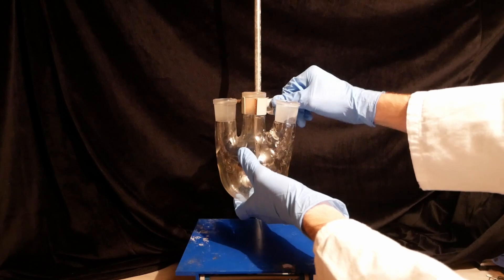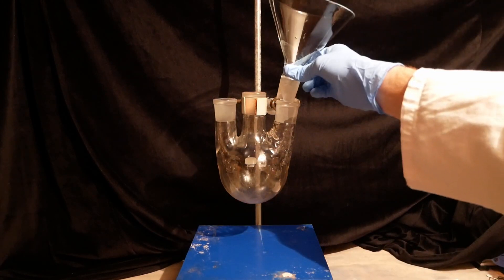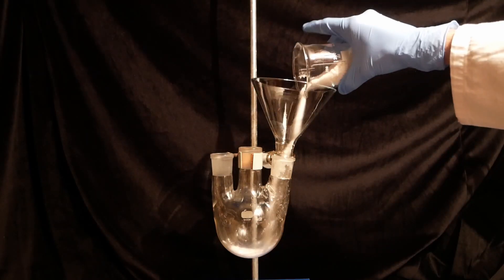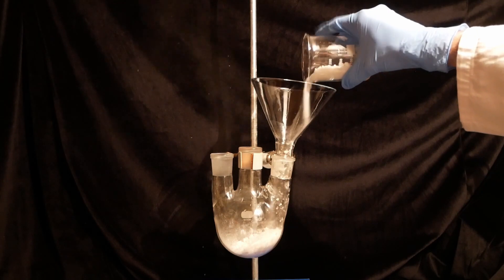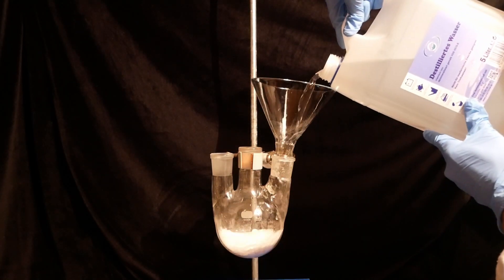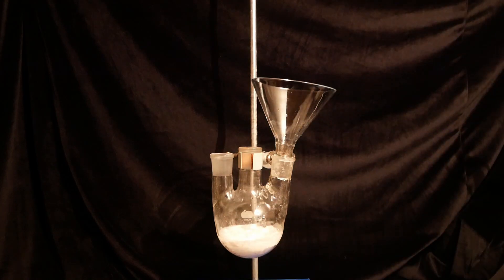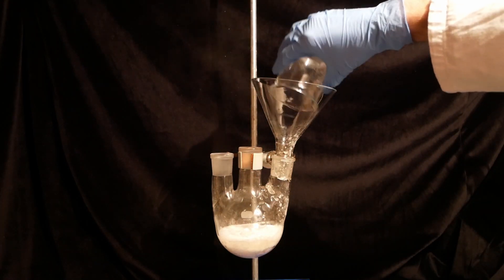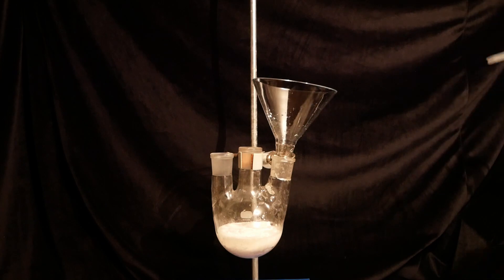A 500 mL three-neck round bottom flask is now mounted on the stand and the benzamide is added into the flask along with approximately 100 mL of water to make a suspension of the benzamide. I hoped that this would prevent the dust from escaping out of the flask, but this didn't work very well.